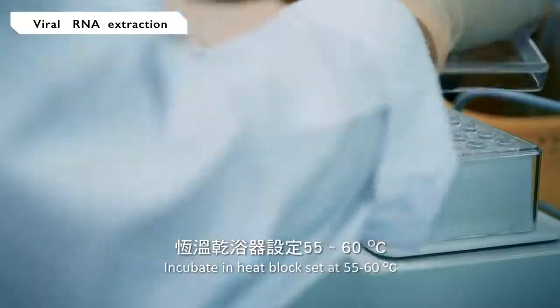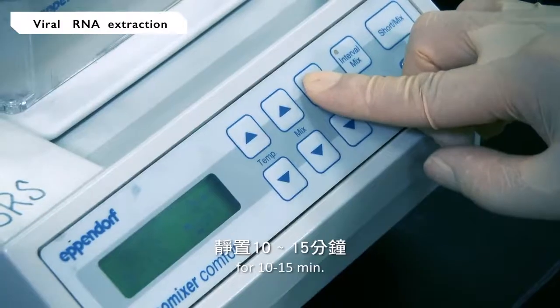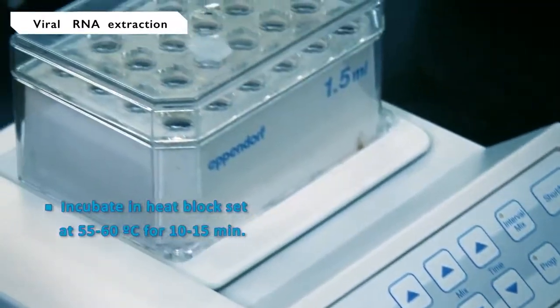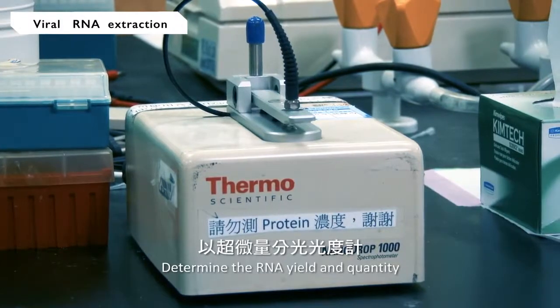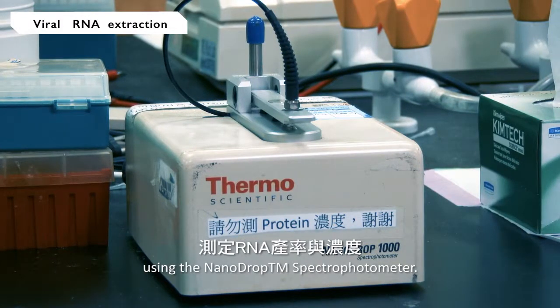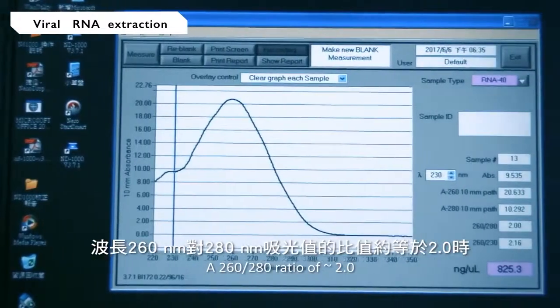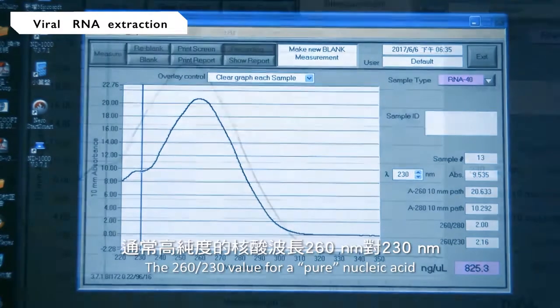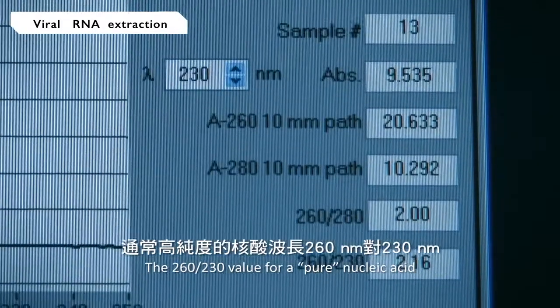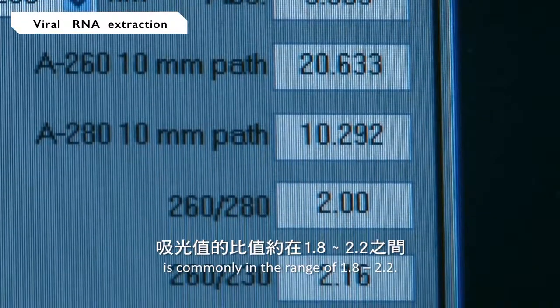Incubate in a heat block set at 55 to 60 degrees Celsius for 10 to 15 minutes. Determine the RNA yield and quantity using the NanoDrop spectrophotometer. An absorbance 260 to 280 ratio of about 2.0 is generally accepted as pure for RNA. The 260 to 230 ratio for a pure nucleic acid is commonly in the range of 1.8 to 2.2.